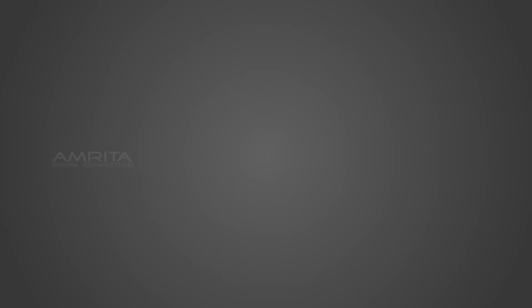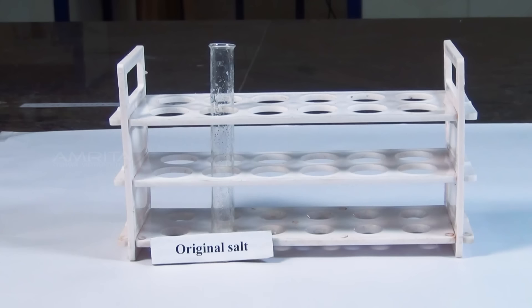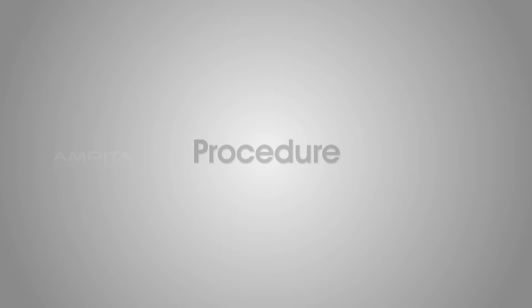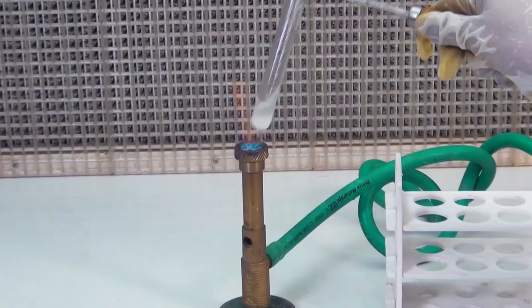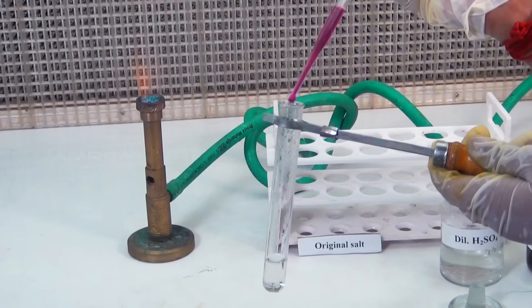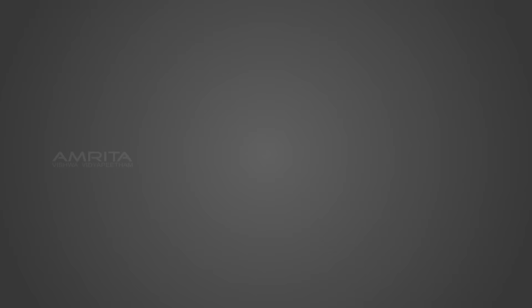Potassium permanganate test (confirmatory). Materials required: original salt, dilute sulphuric acid, potassium permanganate solution, test tube, test tube holder, droppers, and Bunsen burner. Procedure: Take a small quantity of the salt in a test tube. To this, add a small volume of dilute sulphuric acid using a dropper. Warm the test tube to 60-70 degrees Celsius. Now add a few drops of potassium permanganate solution using another dropper. Potassium permanganate is decolourised due to the formation of colourless manganese sulphate, and carbon dioxide gas is liberated.